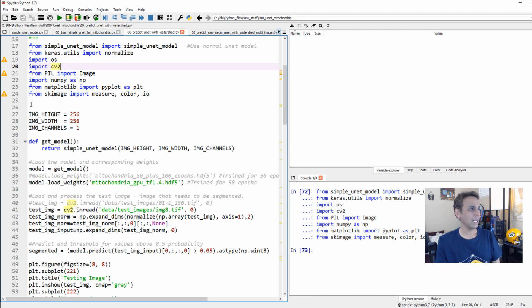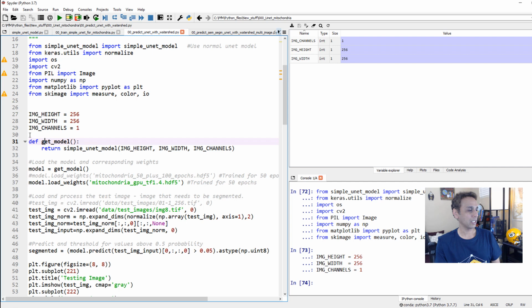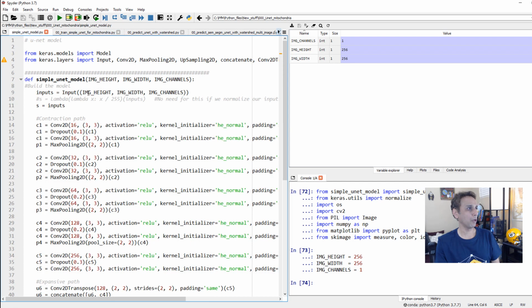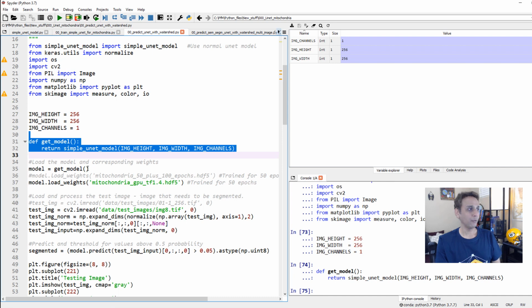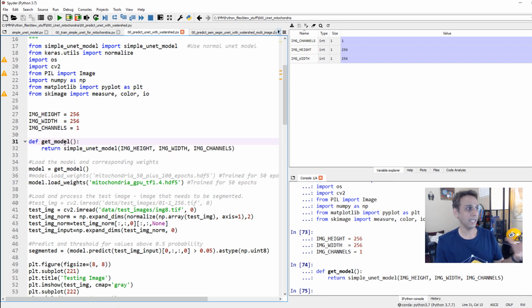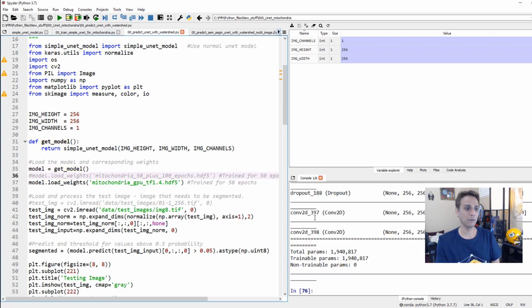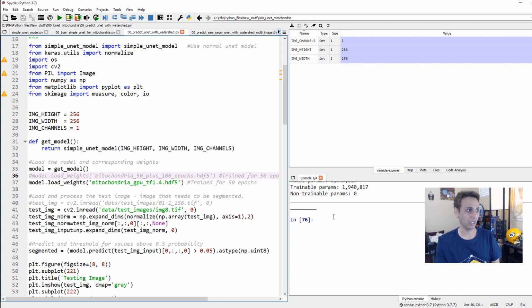Let's go ahead and define our image height, width, and number of channels, and let's go ahead and get our model. Remember, our model takes 3 parameters: image height, width, and channels. That's exactly why we defined it here. Well, we haven't imported it, we just defined that when I type get model, it should get that model. So let's assign that to our model, and now you see this is our model. We looked at it in the last video, so no point in looking at it again.